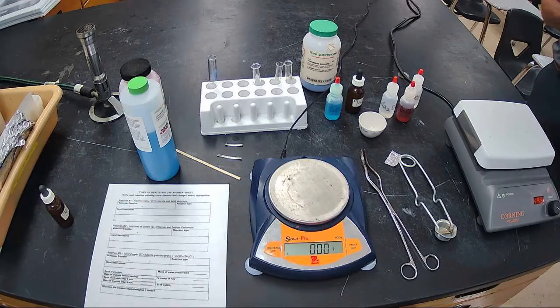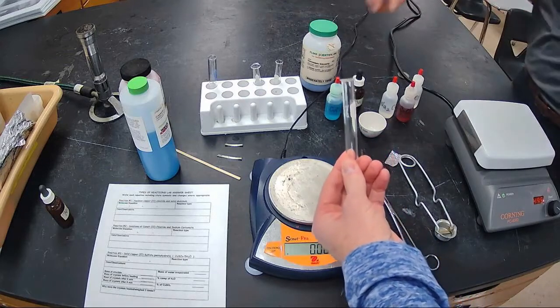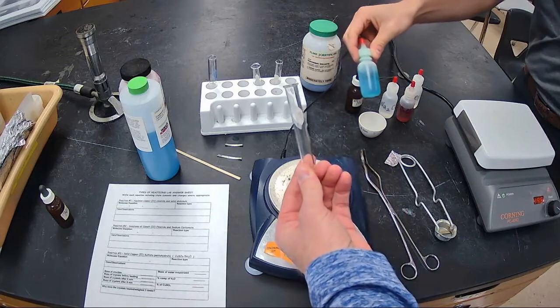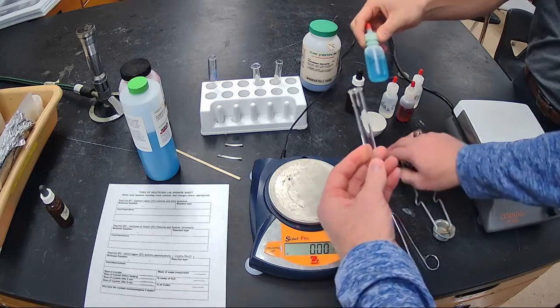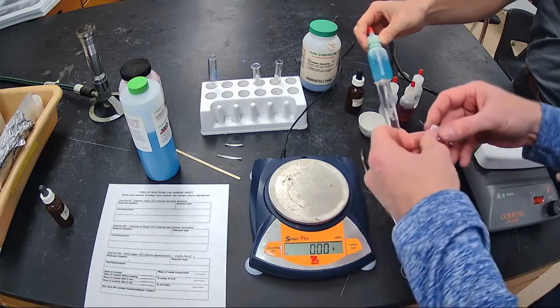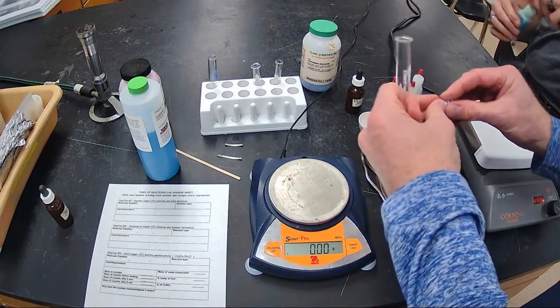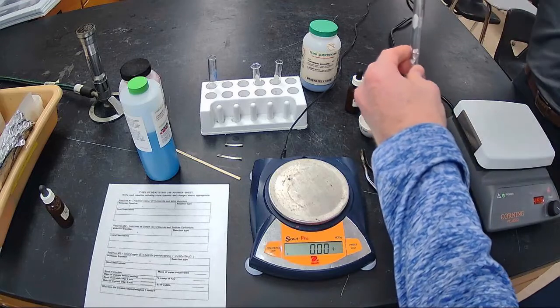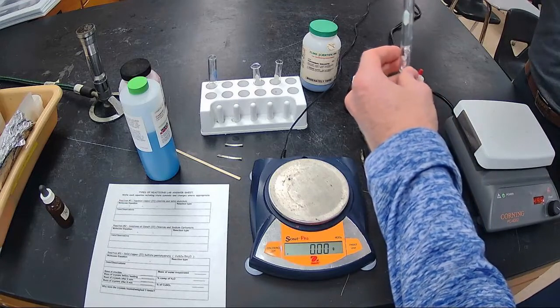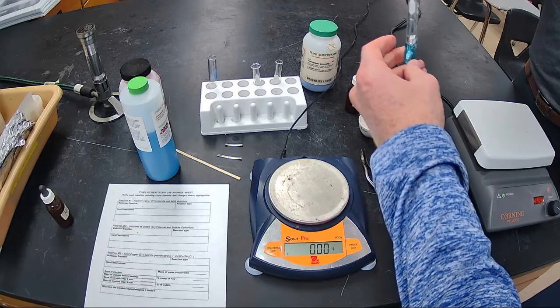We're going to start with the aqueous copper 2 chloride and aluminum, dropped in there. So we have a test tube. Mr. Furiosi, you want to get the copper chloride? Here we go. Probably can't make out the label too much, but it's got the stereotypical blue color thanks to the electron configuration of copper. So we're going to take some aluminum and drop it in here, and cover it. I'll just add enough drops to cover the whole thing. We don't want to be too wasteful.